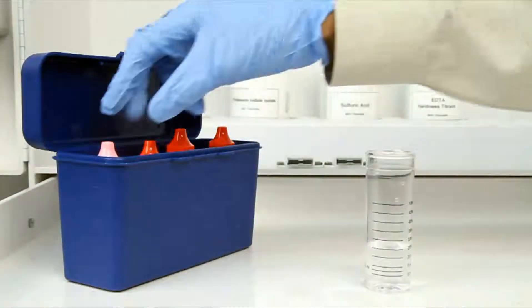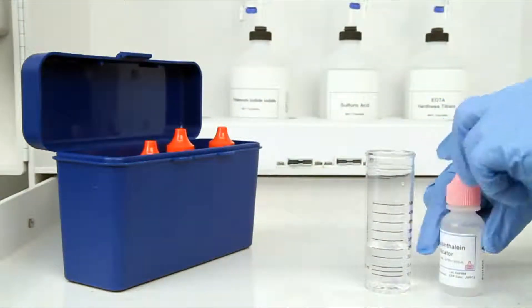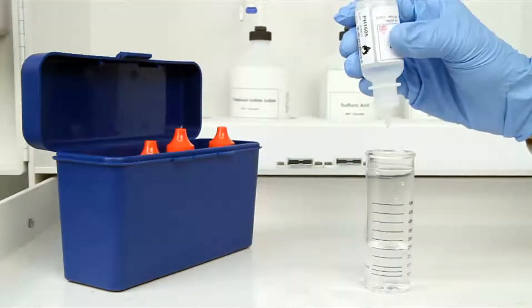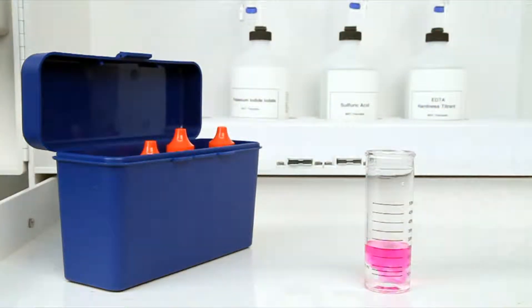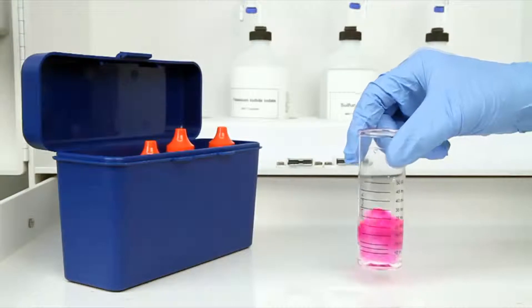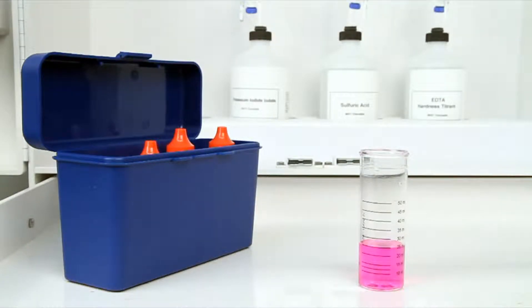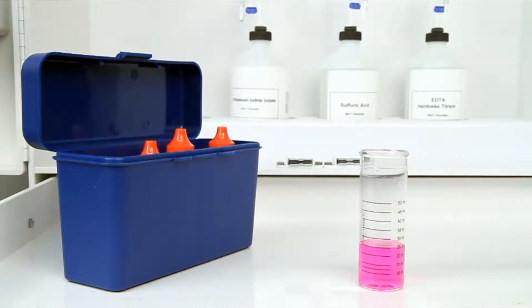The next step according to the endpoint ID procedure is to add three drops of phenolphthalein indicator. The bottle contains a dropper tip, so it's important to hold the bottle vertically to get a consistent drop size. After the addition of each reagent, it's important to swirl the vial to make sure the reagents are properly mixed. In this example, the sample is turned pink, indicating that there is P alkalinity that needs to be titrated.